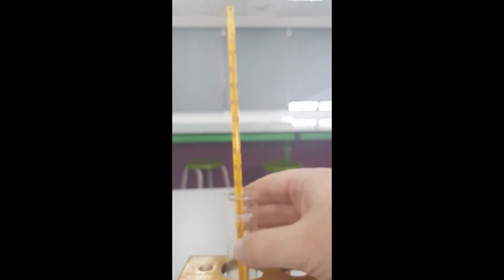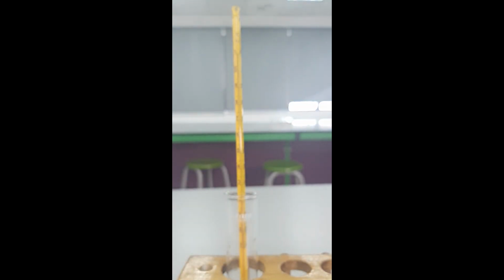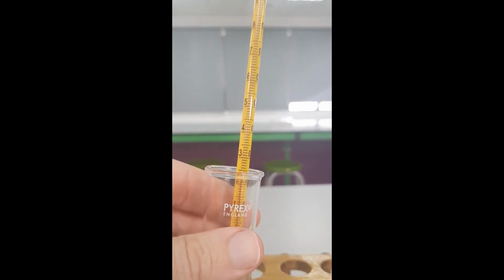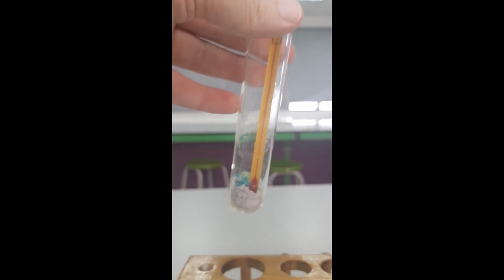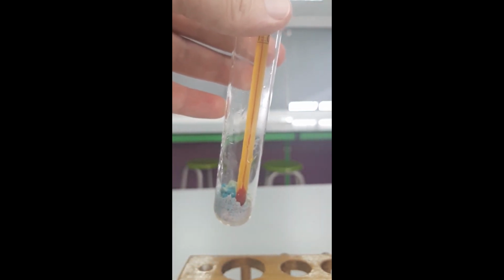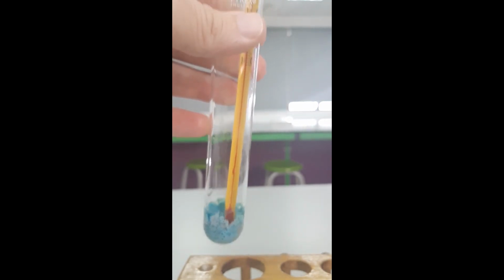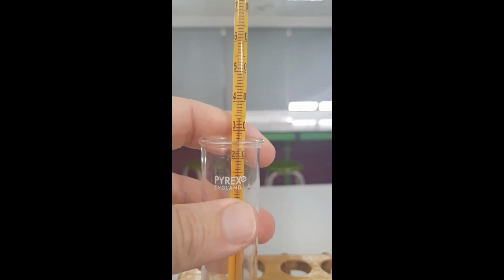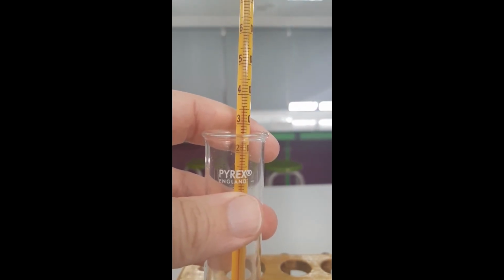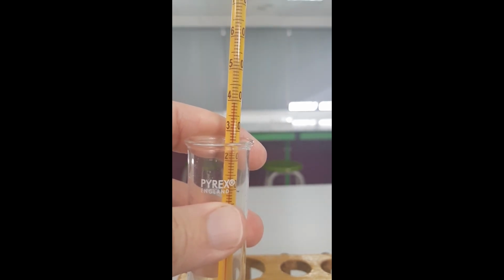And what I'm going to add is distilled water. So this time I'm doing the reaction backwards to what it was before. Previously water came out, now I'm going to add water in, and we should see a couple of changes. Firstly, put a few drops in here, it's going to change to a blue color, and that blue color, some of it's dissolved there, so I'm actually getting a blue solution. That blue color tells us water is present, but what's very interesting, the temperature is rising. So we can see it started as 23 degrees Celsius, it's just hit 40 degrees Celsius there.